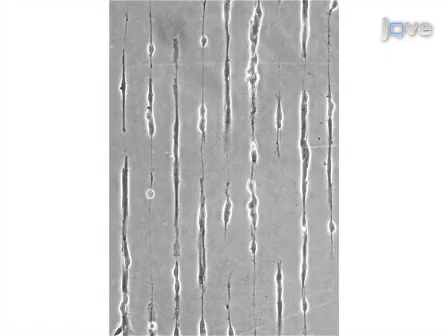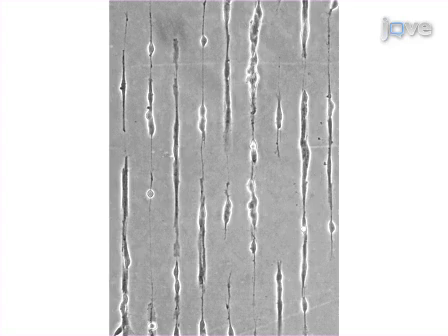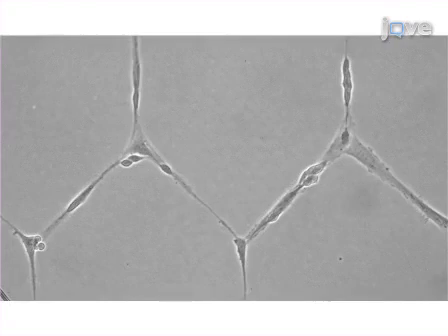A typical result of implementing the plasma lithography technique is the formation of a pattern of cells that resembles some arbitrary or natural structure. An example of this can be seen here in this figure, with neurons that have been differentiated with retinoic acid on a pattern of lines, and here in this figure where lines and networks of neurons have been created.